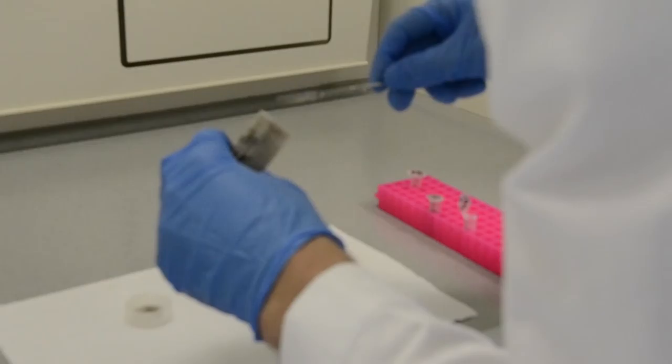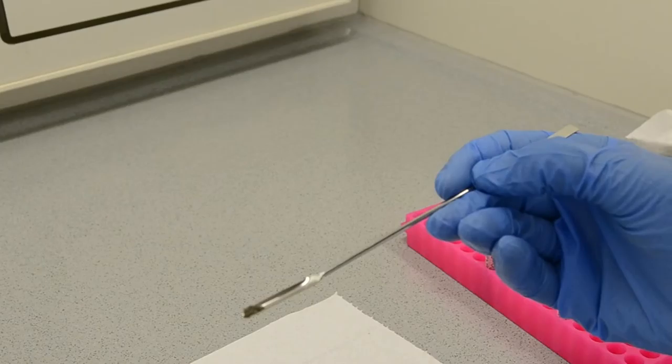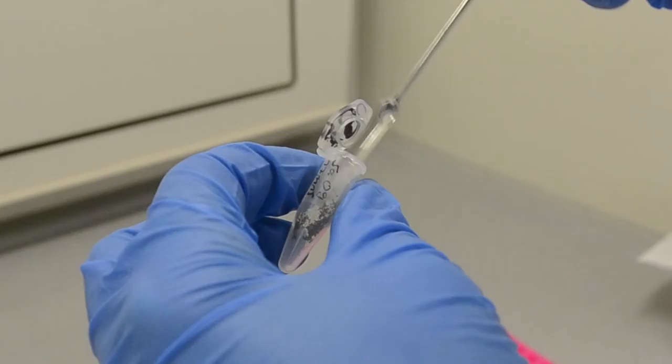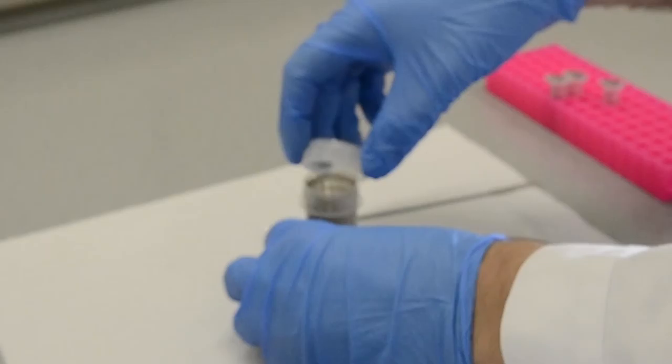DNA from these three tubes is then pooled together, RNA digested and cleaned up. Then, it can be used for DNA metabarcoding. We divide up the tissue onto the three tubes, because we cannot use too much tissue for DNA extraction in a single tube.